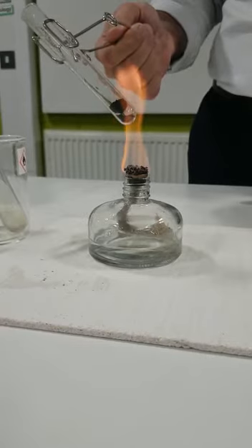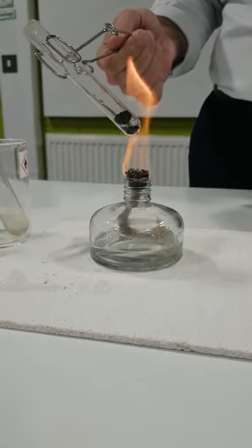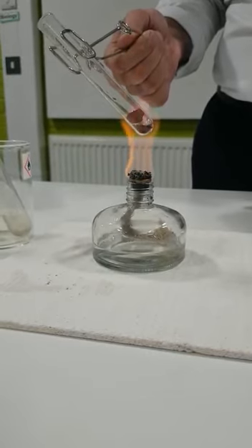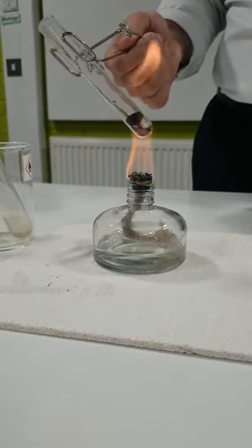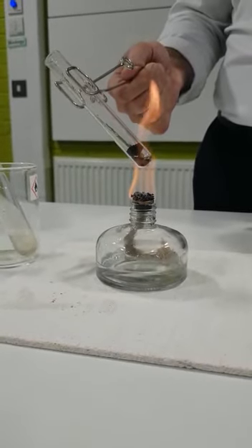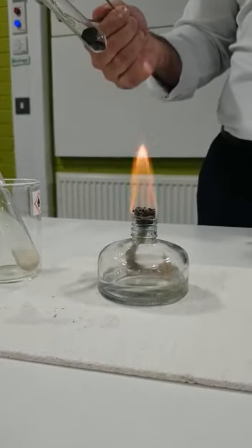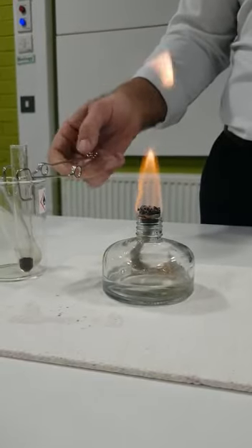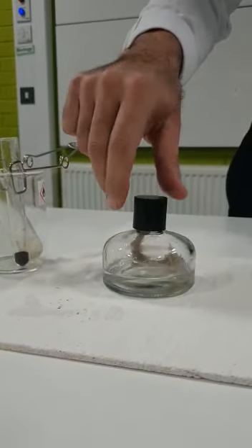As you can see, again, the gas pushes the top part, and now I've got two parts of the powder. All right, once you have experimented with this, it is done. You can bring it, you can discuss your observation with your teams and put it back in the beaker and simply turn off the burner.